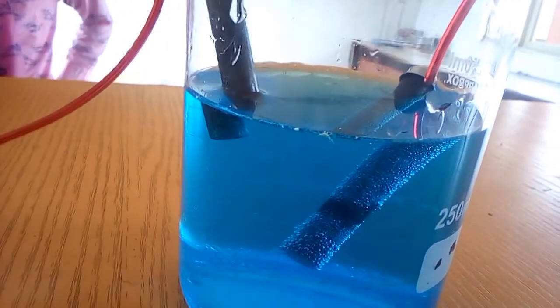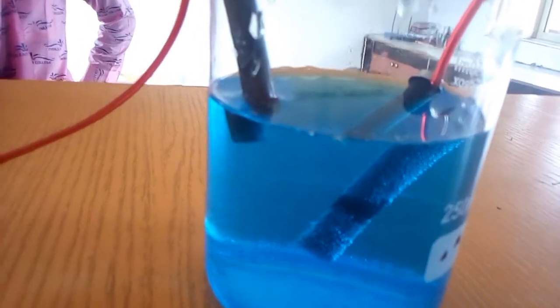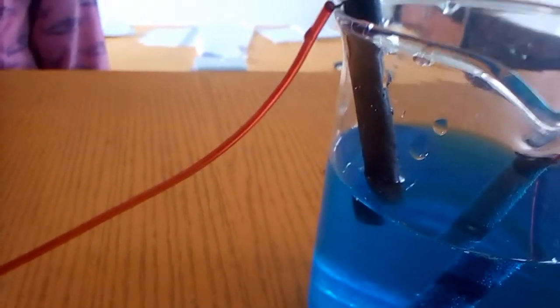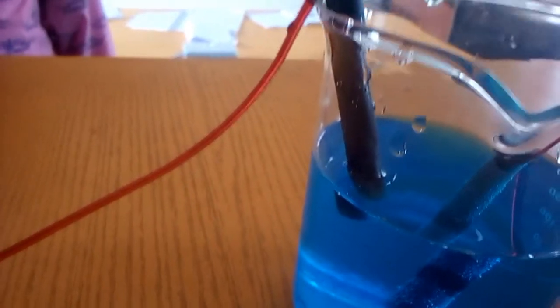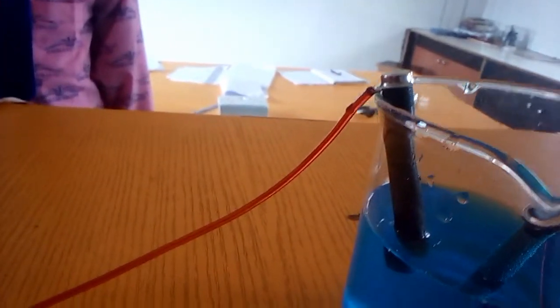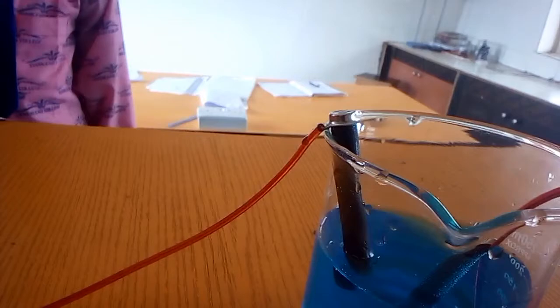We can also go to the cathode. This is the anode having bubbles of oxygen gas. Then going to the cathode, you notice the cathode is black at the beginning of the experiment, but when you check it now you discover that it's having a kind of change in color, which means that copper has been deposited. So let's remove the key and observe that.